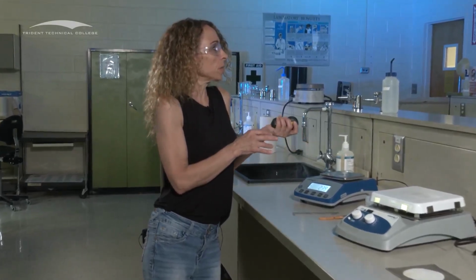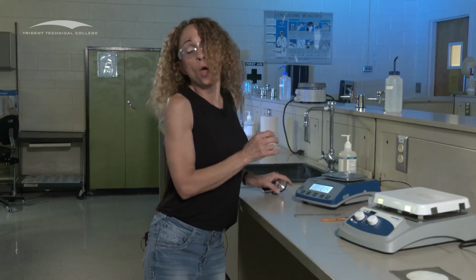All right, we use this technique for 2 different reasons. Okay, one reason, or why would you use this technique? You would use it to dry off a product, get all of the water off of a product, which is why you're doing it in the alum lab. And another reason why you would use this technique is to make sure that a reaction has gone to completion, which is why it's being used for the baking soda lab.